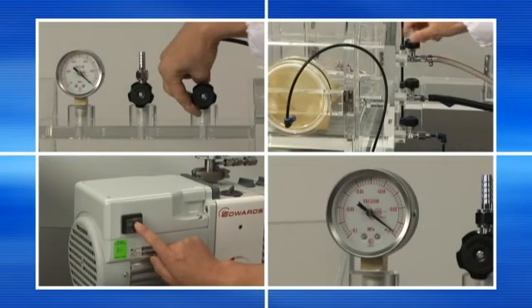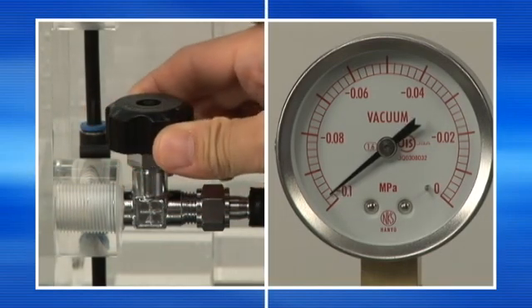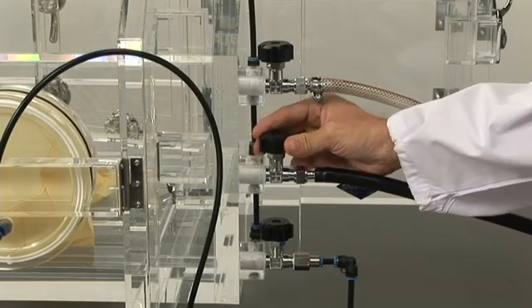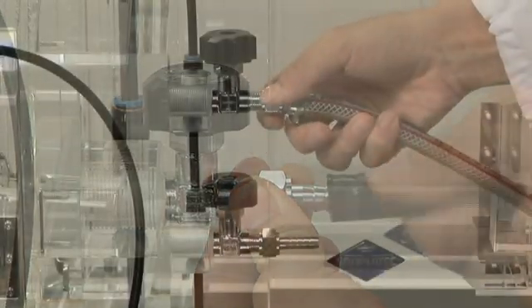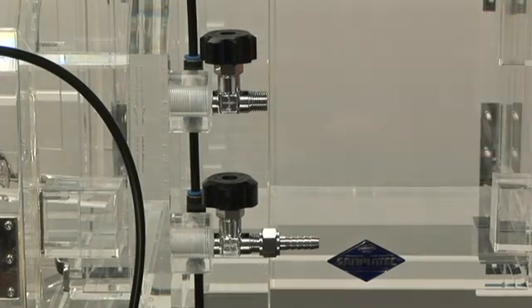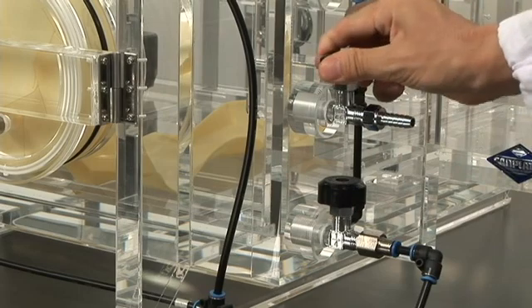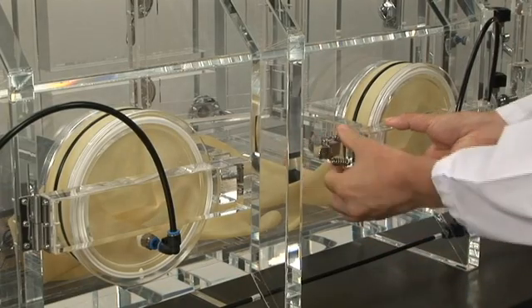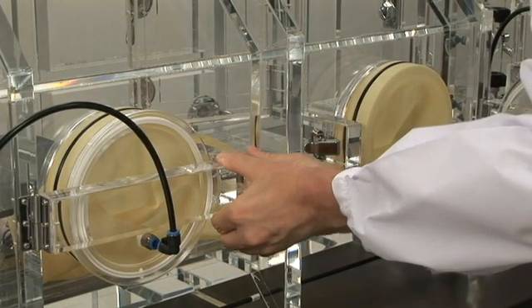Repeating these tasks two or three times can create a more steady environment in the box. After gas replacement, close all valves and take out each piping. At last, open the valve for the glove port and the valve for the gas piping. Then, bring the box's inside environment back to atmospheric pressure and remove the port cover and start your task.